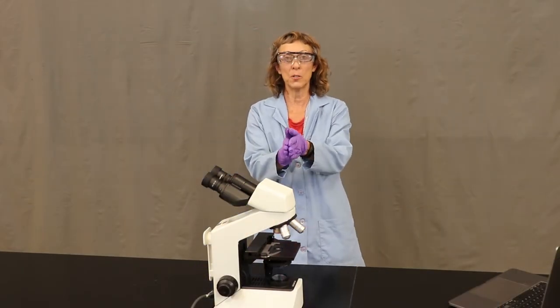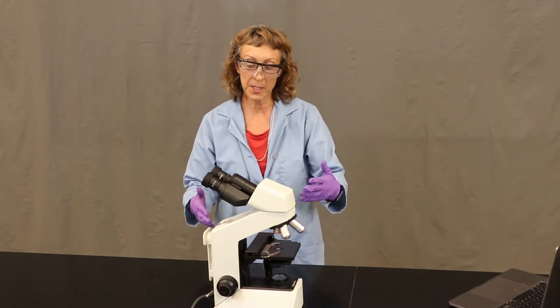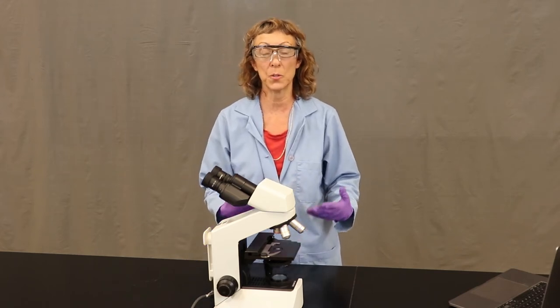All right, so we're going to go over an introduction to how to use a microscope, and I'm just going to have you watch while I show you some of the parts of the microscope and how to use them.